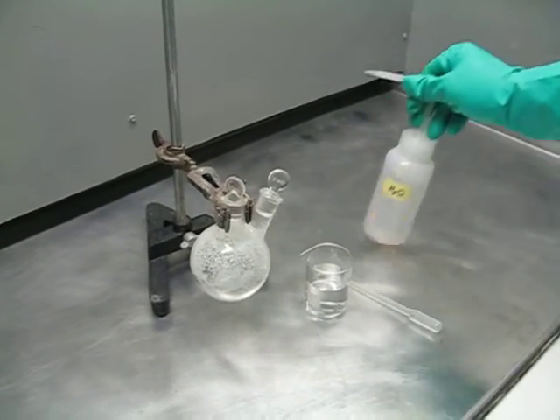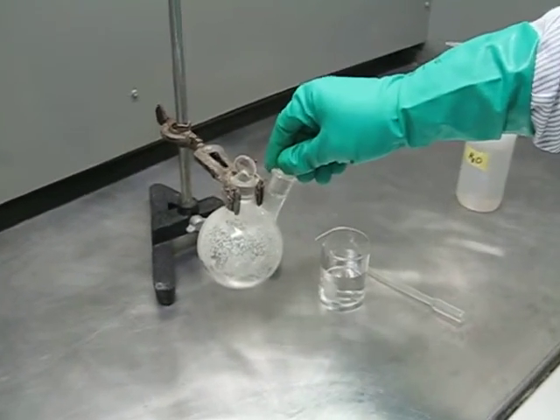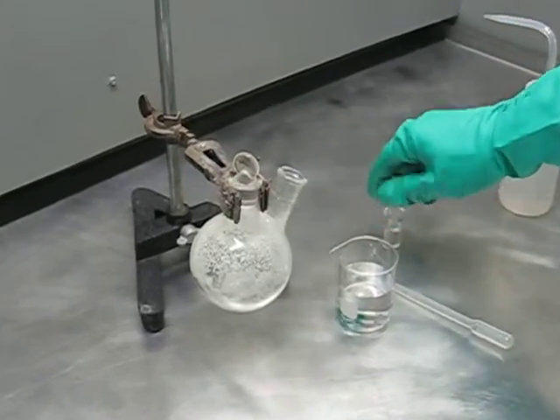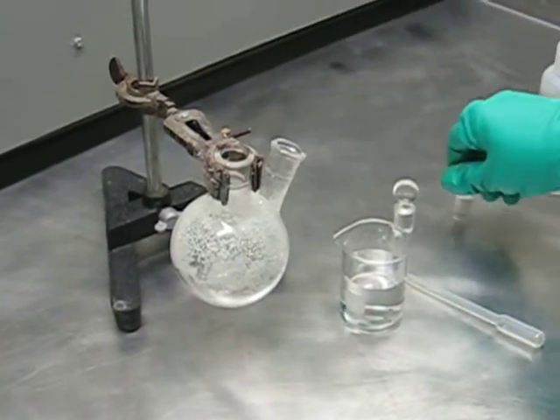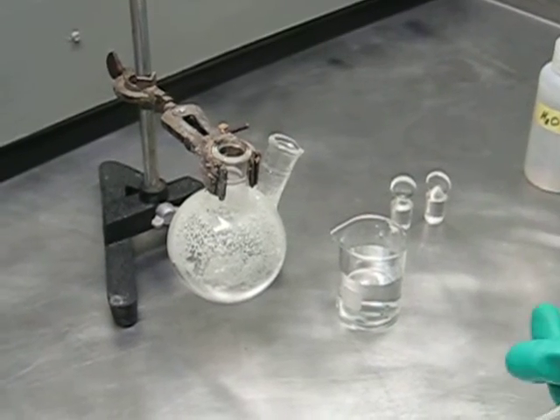I am going to start off first with just the pasteur pipette and just add a little bit and see what is going to happen here.